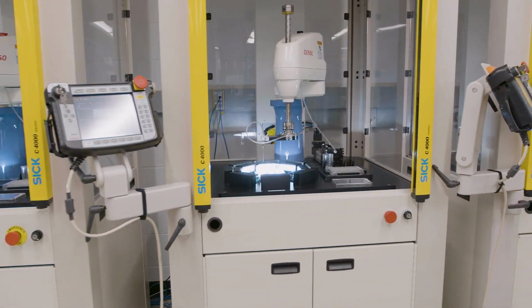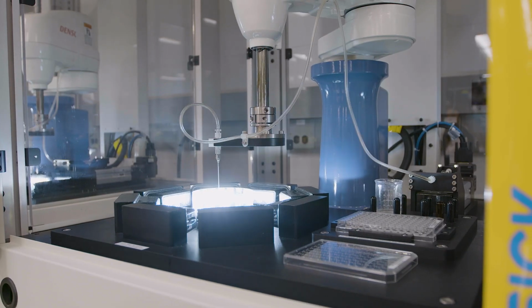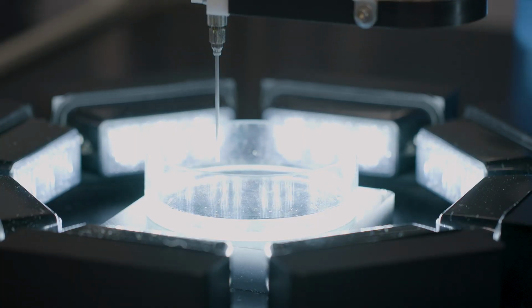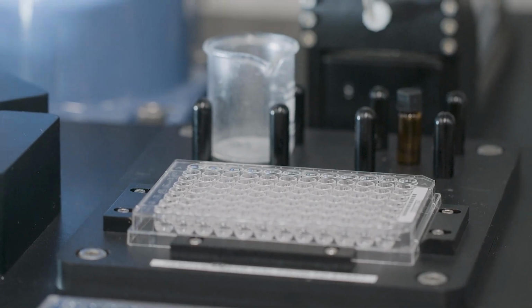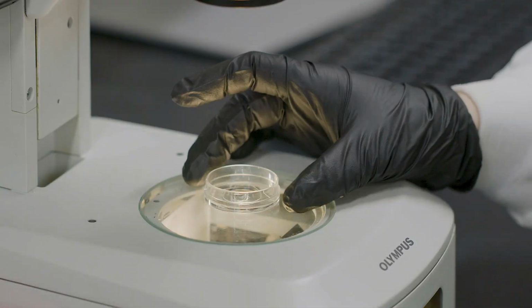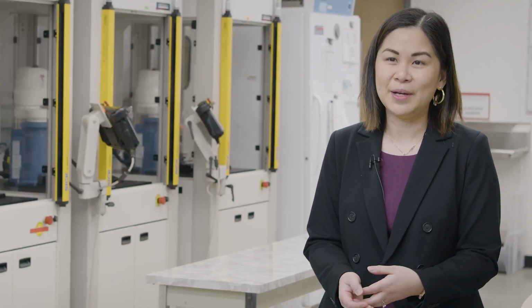High throughput screening in our model is actually looking for chemicals in an automated way, a robust and systematic way, to say if this chemical is a bad actor or a good actor, and checking the bioactivity. And right now we're well known in the field for being able to help prioritize chemicals into either of those bins. But that's just the start.